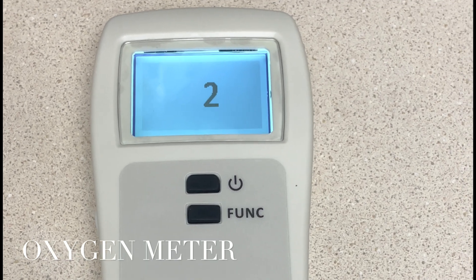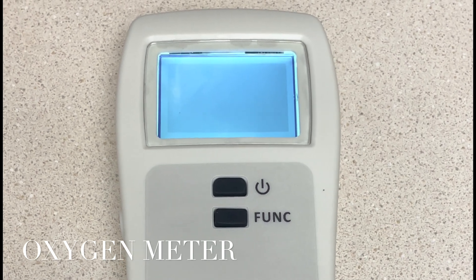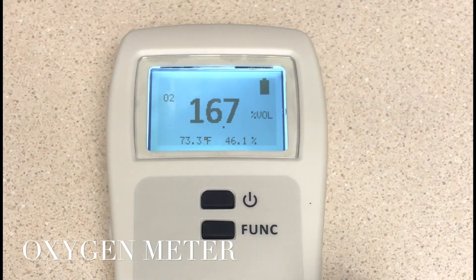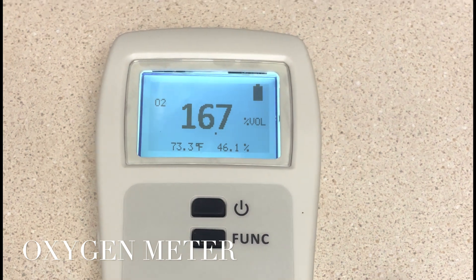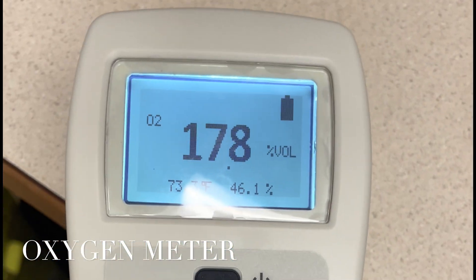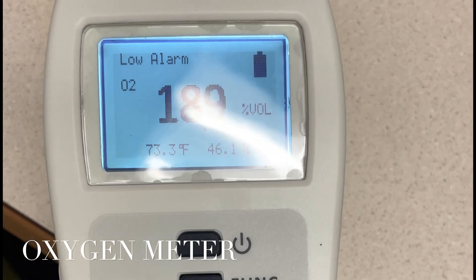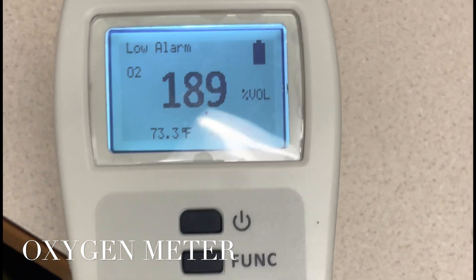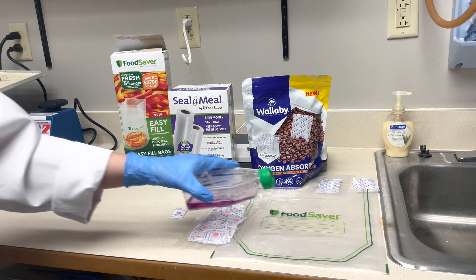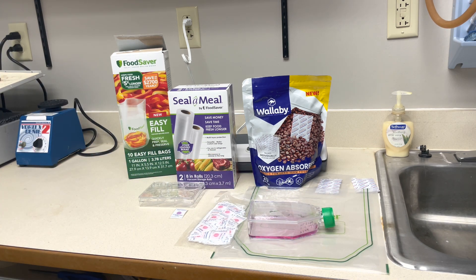There are alternative ways to measure the oxygen concentration. We sometimes use the oxygen indicator dots to get a general idea, but we also use this meter shown here, which gives more precise readings. It measures the percent oxygen by volume in the air surrounding it. And lastly, of course, you'll need the cells that you want to treat, including any other materials needed for cell culture.